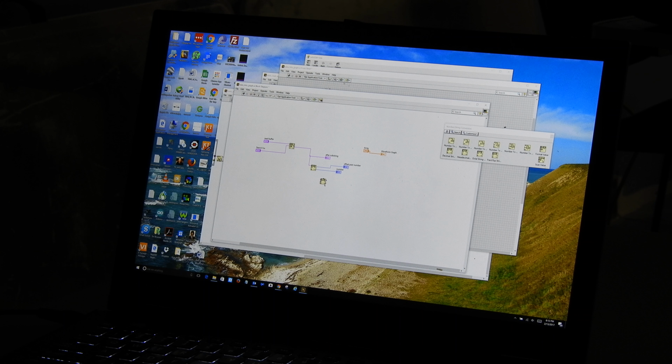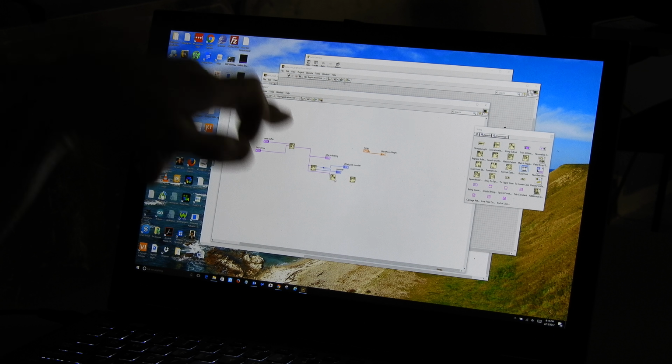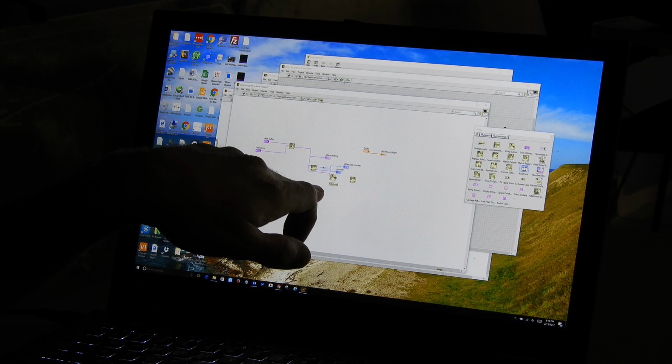Oh boy, we're going to need to actually also string subset. Okay. So once we've done this and we pulled this number out, I'm going to take this offset number and I'm going to feed the offset to the offset here. And what this function does is it's going to strip off that 0 at the beginning and allow us to start with the next number. And I'm going to take the result of that.